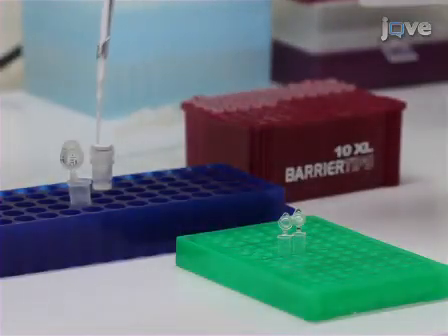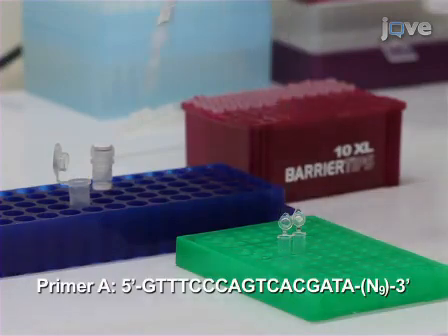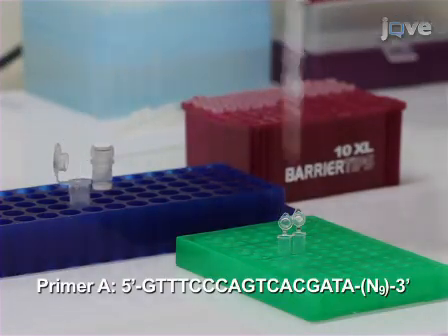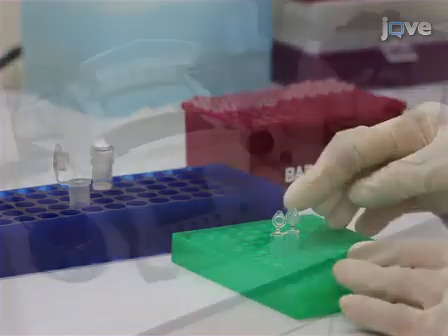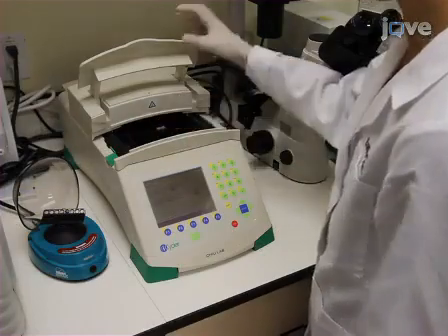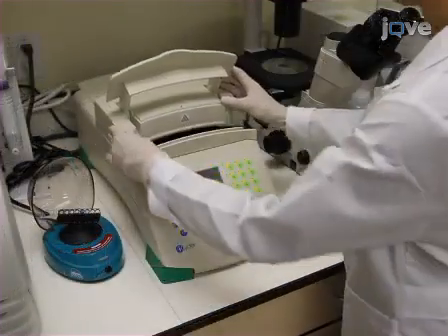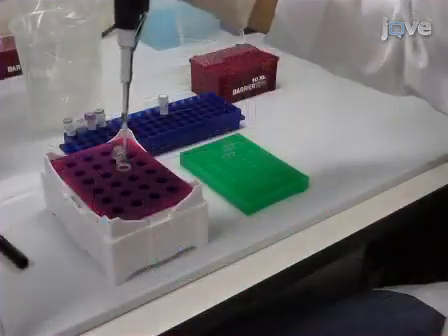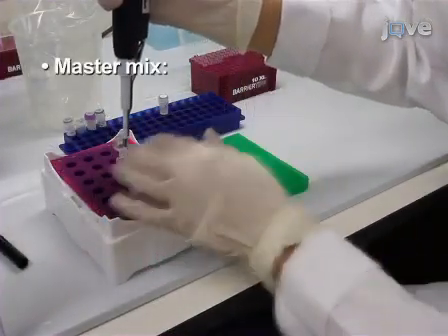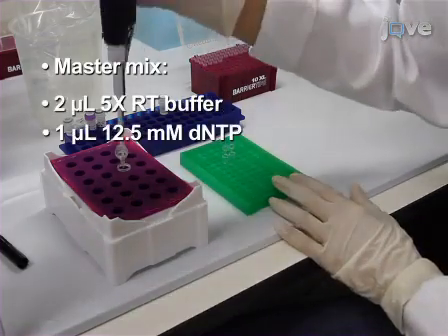Using a thin-walled 200 microliter tube, add 1 microliter of primer A at a concentration of 40 picomoles per microliter to 4 microliters of extracted RNA. Heat the sample to 65°C for 5 minutes in a thermocycler, and then let the tube cool to room temperature for 5 minutes.